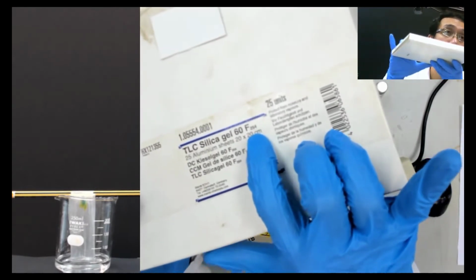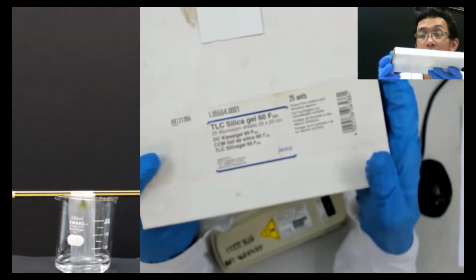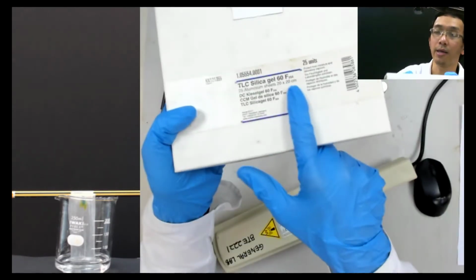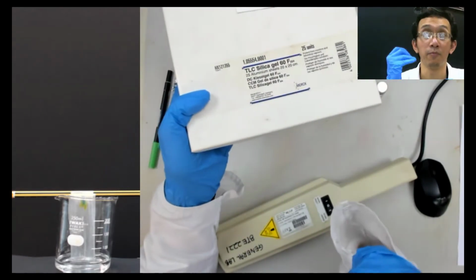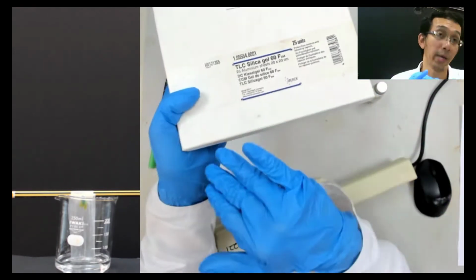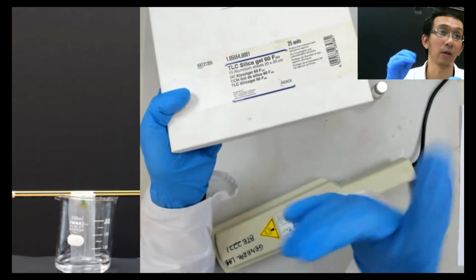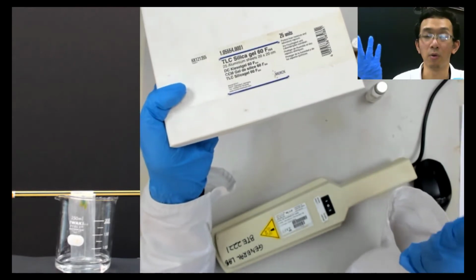The smaller the wavelength of any electromagnetic spectrum, the higher the energy it has. The higher the energy, the more it can penetrate your cells and create havoc. So if you see something like this, it can be very dangerous. That's why when people switch on the UV, they go away. They let the laminar flow sterilize for a few minutes, then close the UV, and then start working with the normal light again.